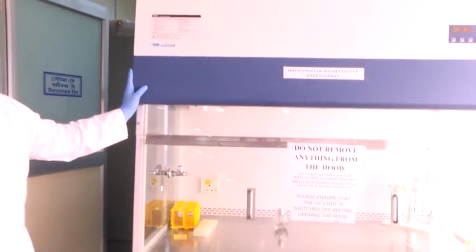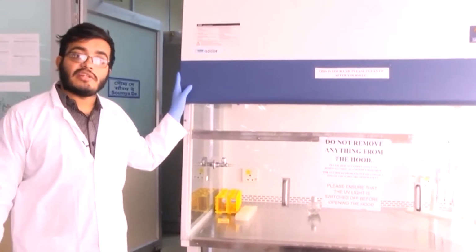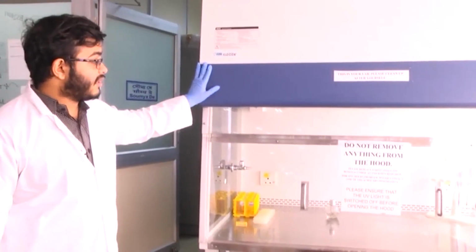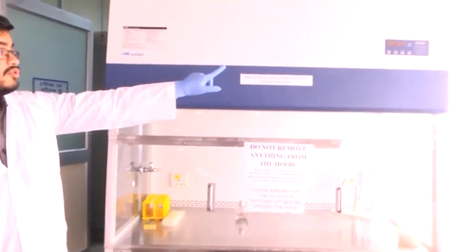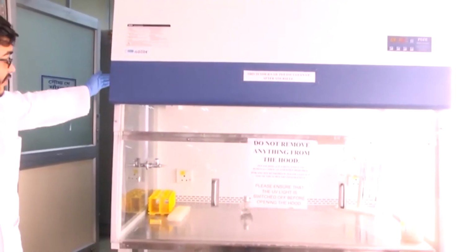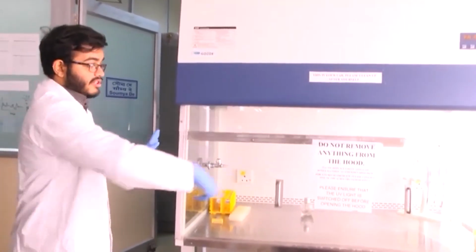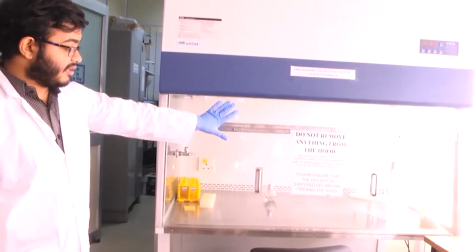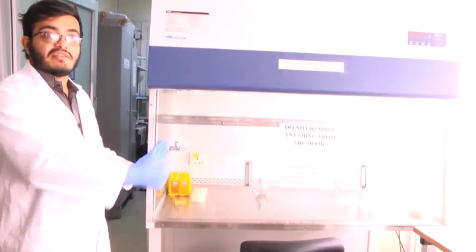This instrument is a laminar airflow cabinet, and you will be looking at it later on in further detail in the subsequent lectures. In general, once you open this and it is switched on, there is an airflow filter and it maintains an airflow positive pressure which prevents outside air from entering this enclosed area, and this enclosed area is sterile. There are UV lamps which sterilize the inner region when not in use, and also we keep spirit lamps and burners where we light them and we heat sterilize and alcohol sterilize this entire region.